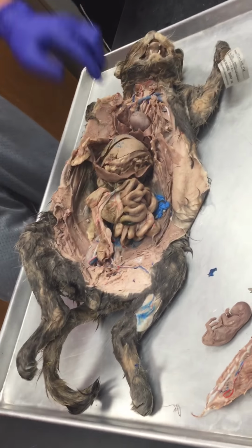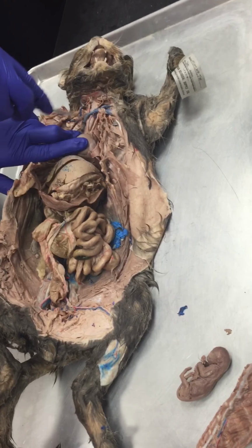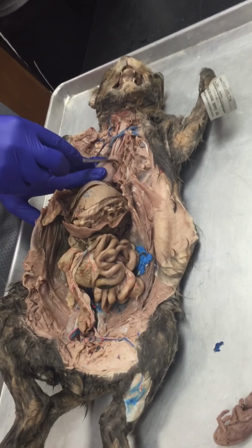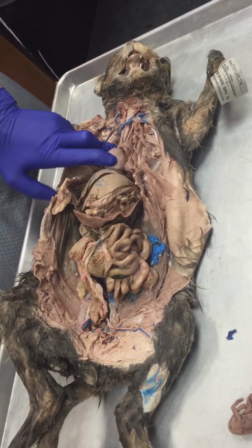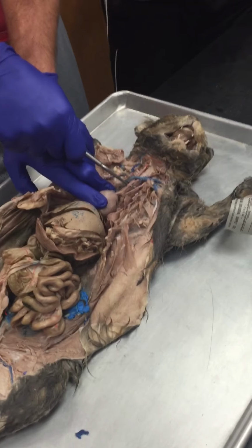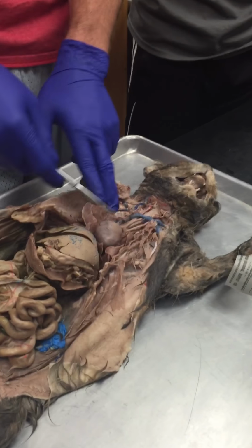Yeah, that'll be easier. Alright, so starting from the heart, if we look at this guy, this is going to be the aorta coming off the top. And off of the aorta we see two branches. The first branch that we come to is going to be the brachiocephalic artery. The second one is going to be the left subclavian artery, okay?